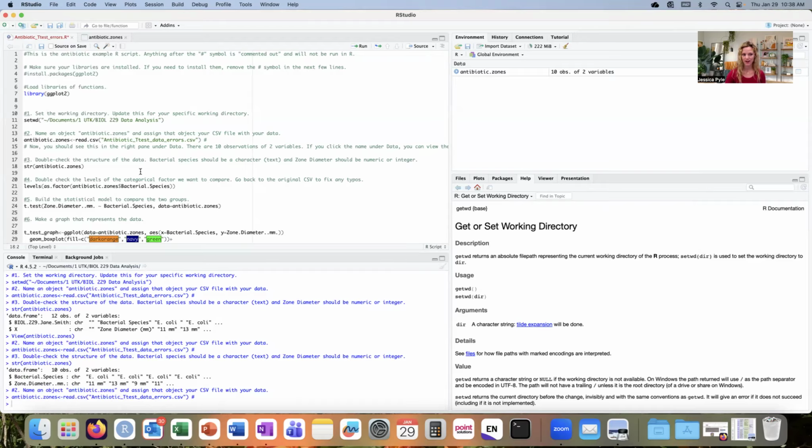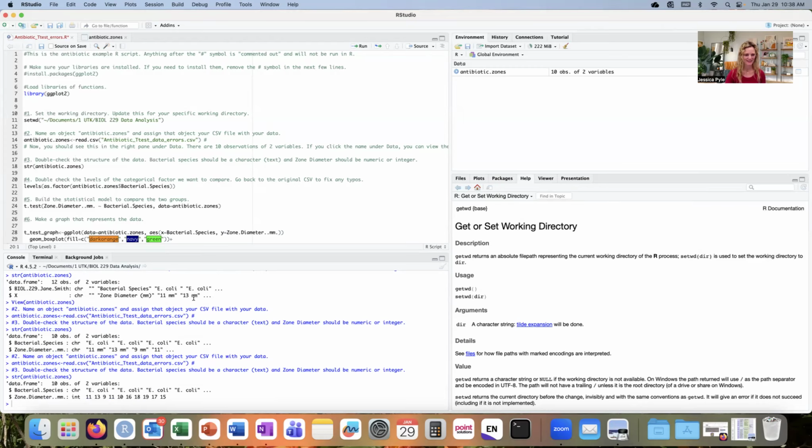Okay, now let's try inspecting the structure again. Now I'm looking down in the console. I have a data frame, 10 observations of 2 variables. In my first column called bacterial species, those are all character values with E. coli as my preview. Then my next column is called zone diameter, and now it's imported as integer type, and I have these whole numbers.